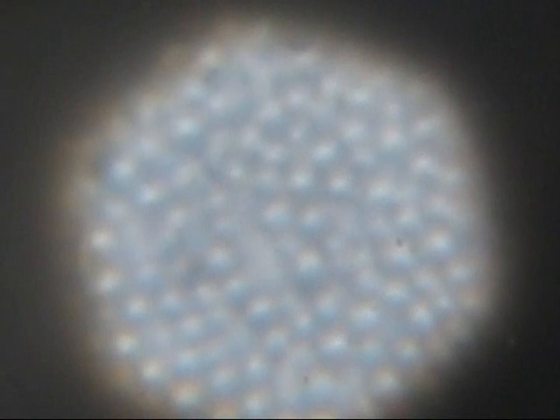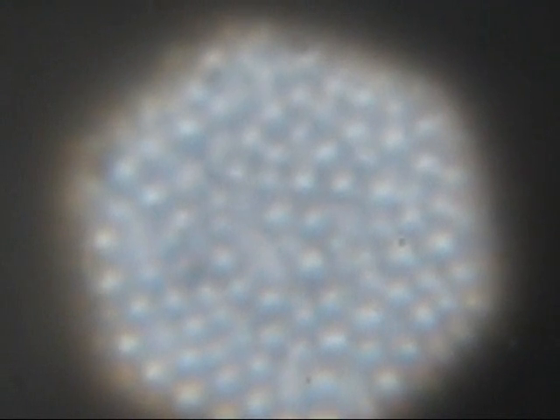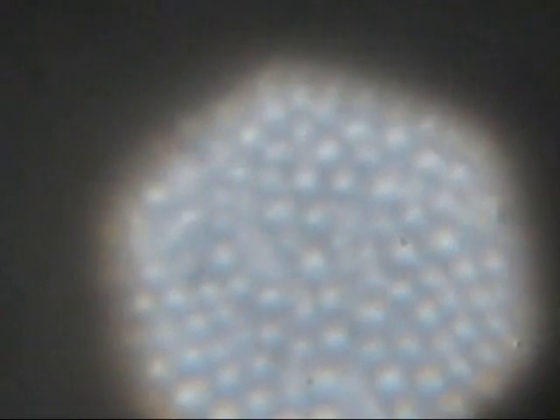This is the highest zoom level. Apparently stuff is a bit blurry at this zoom level, but you can see the cells up close there.